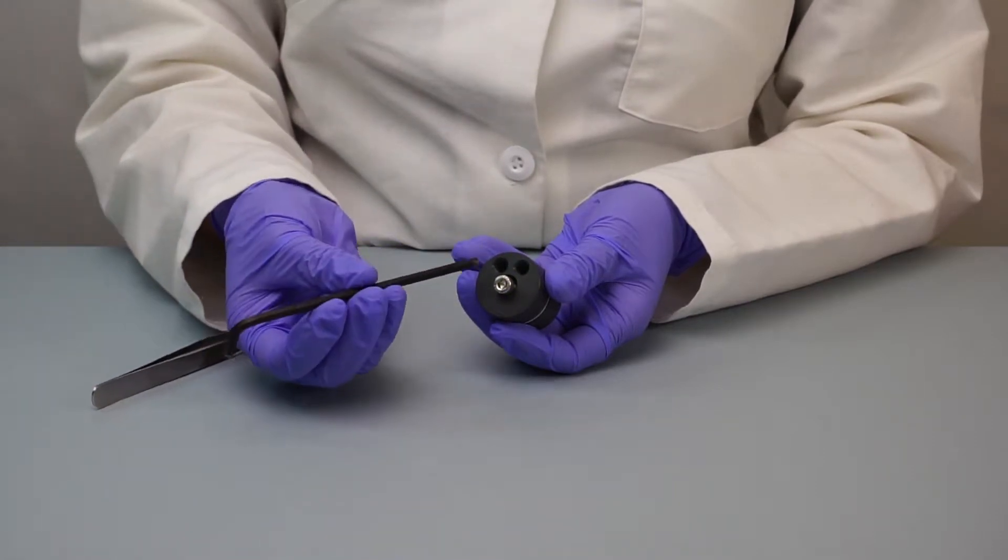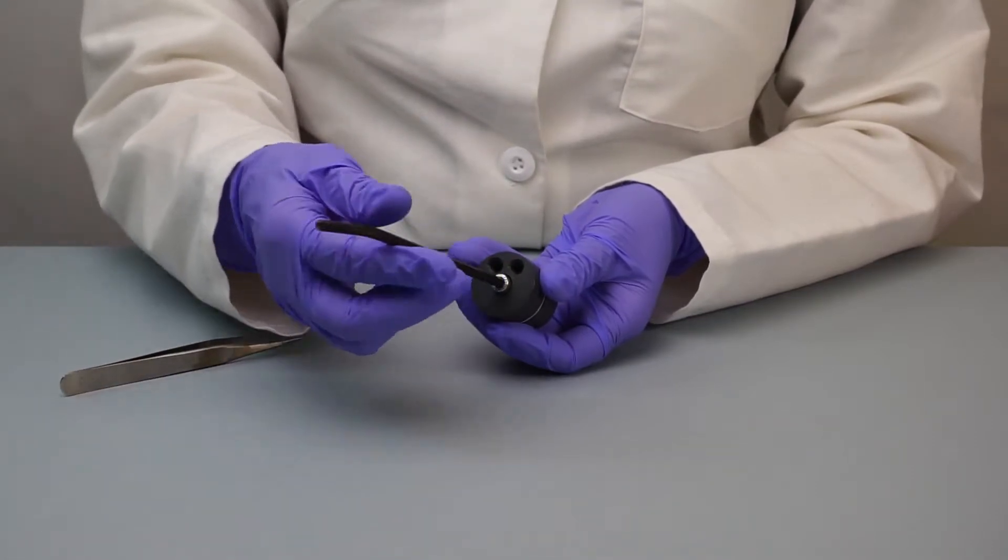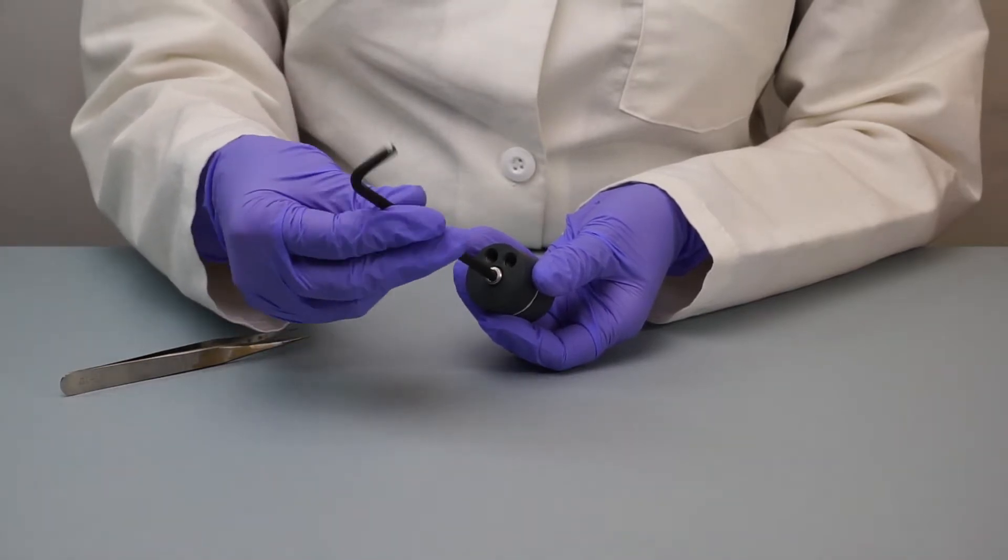It is not recommended to screw the housing too tight since it may deform the filter and cause leakage.